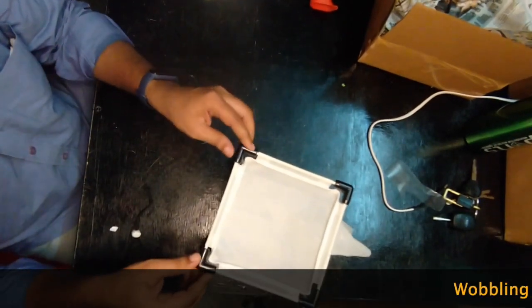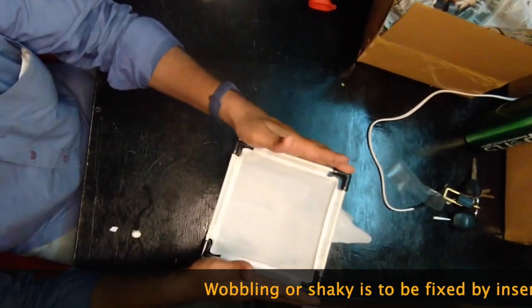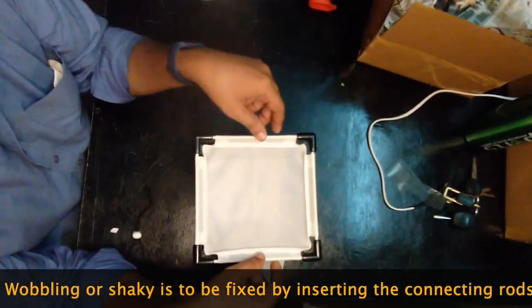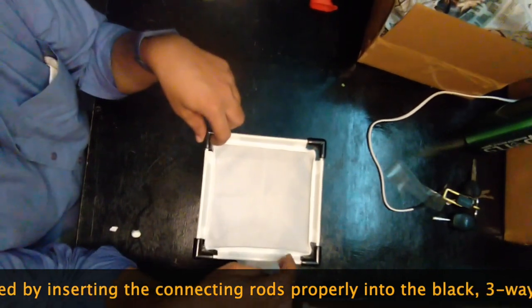If any measurement is unequal, try to see if the spoke has properly fit snugly inside into the hole. If not, then try to press a bit.